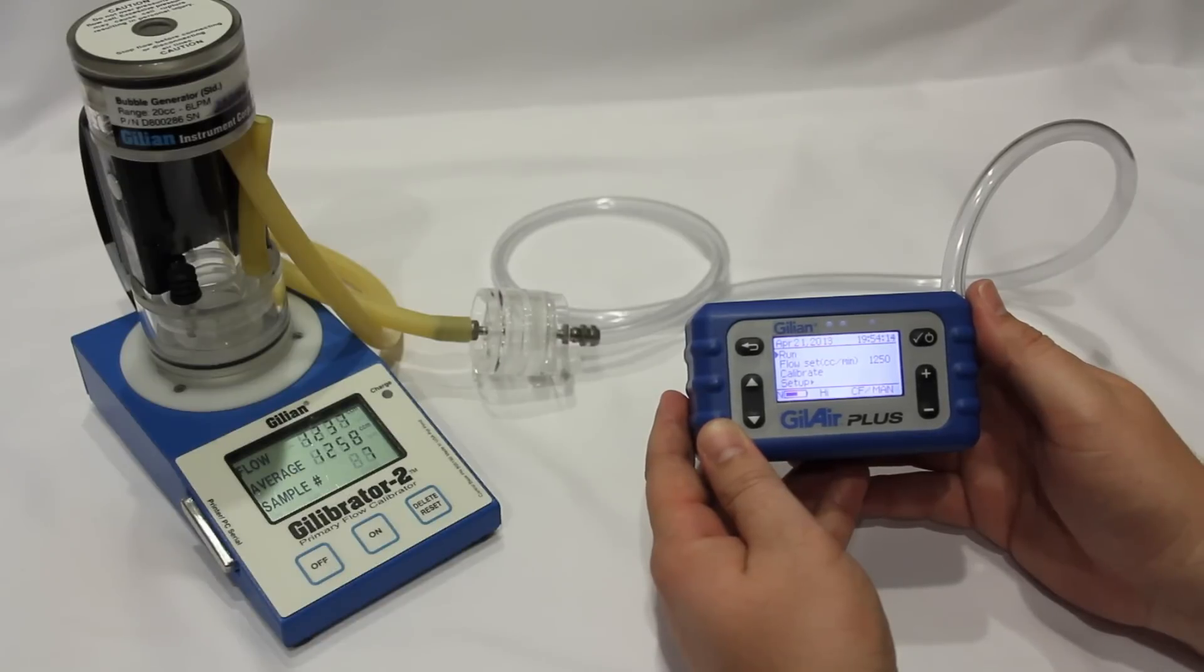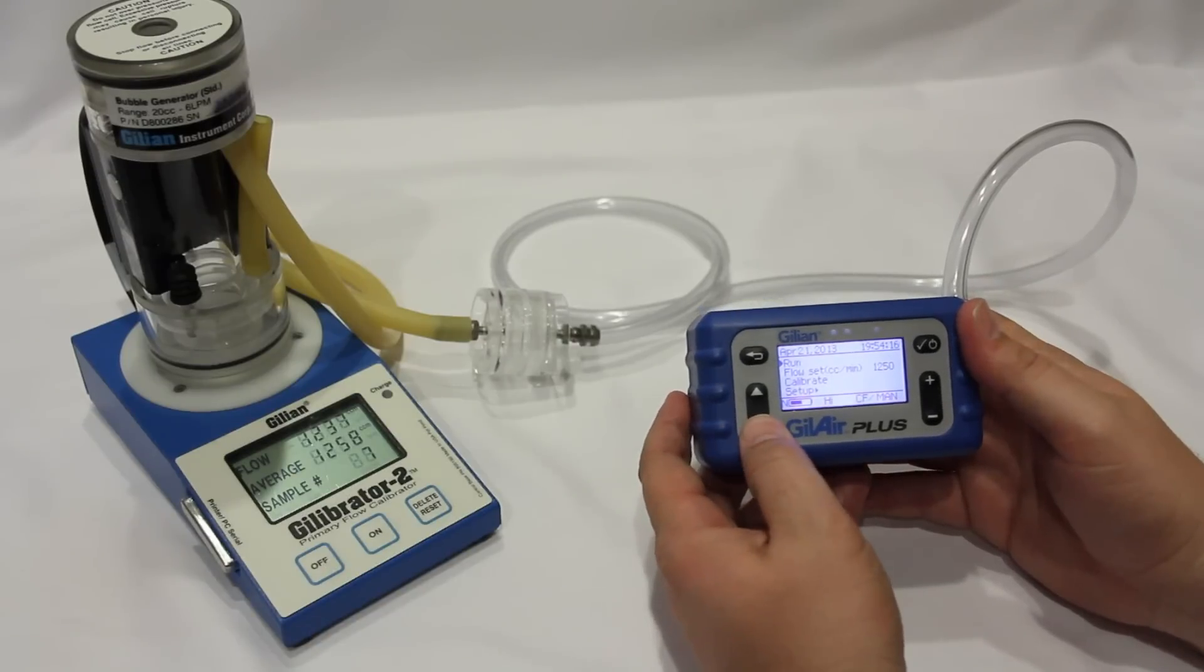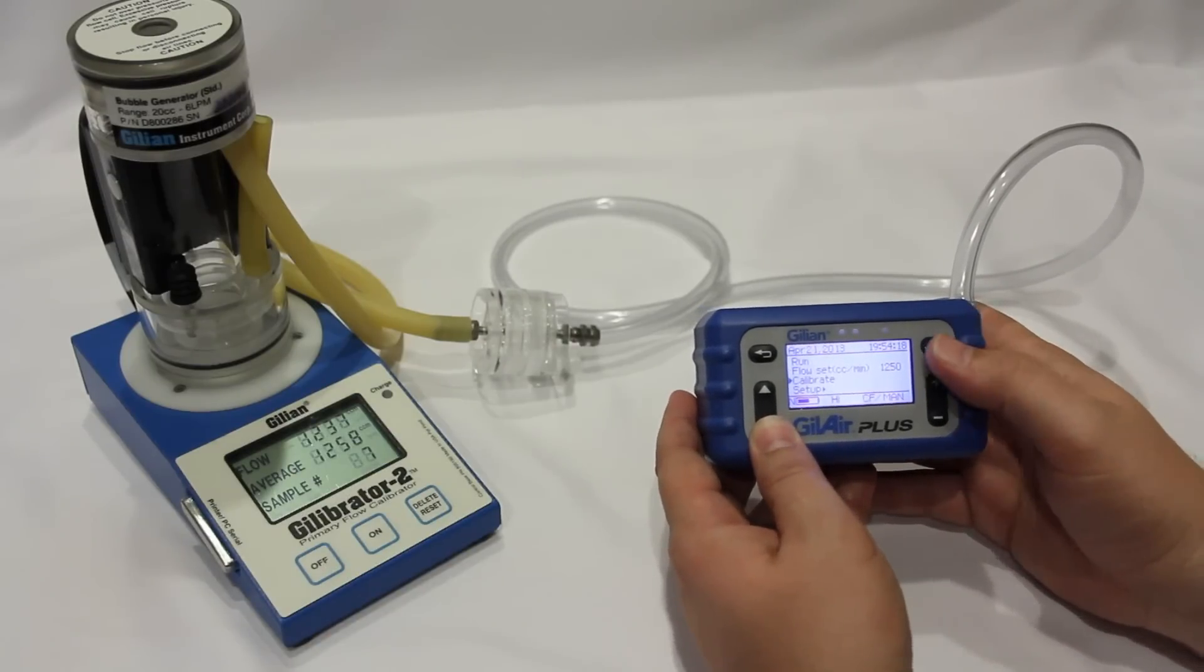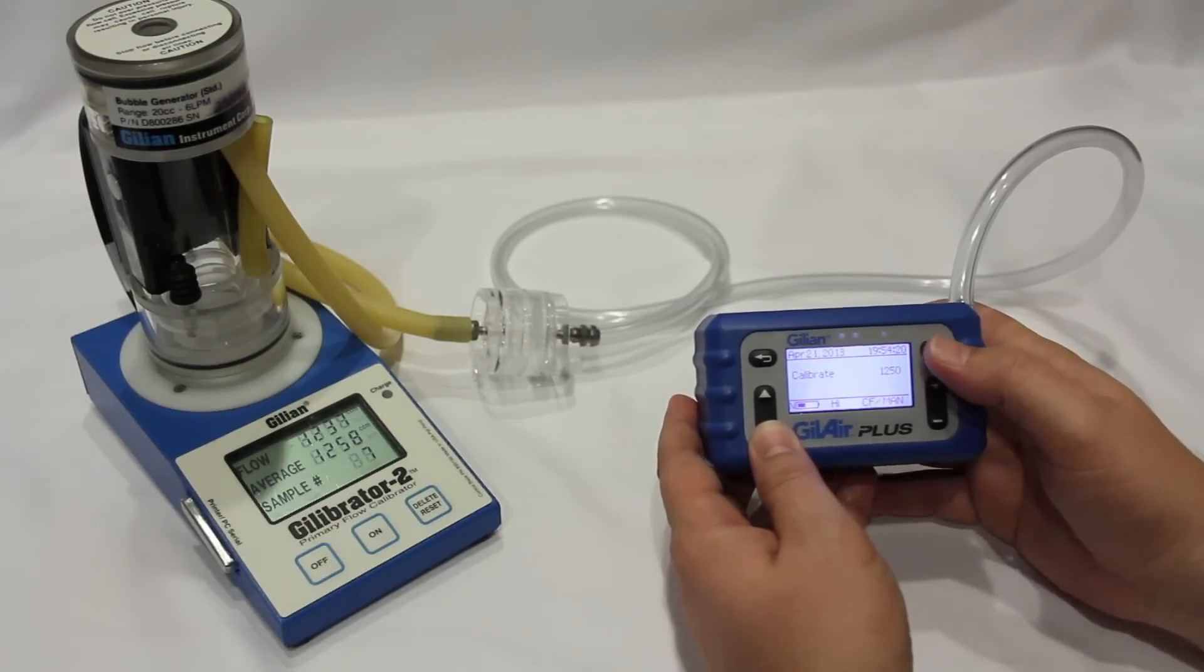Access the main menu, scroll to calibrate, and press enter. The pump will begin to run.